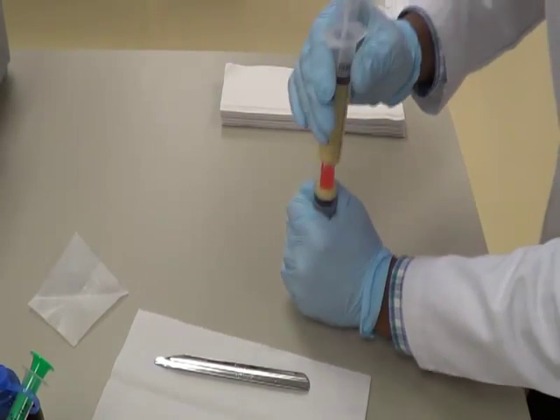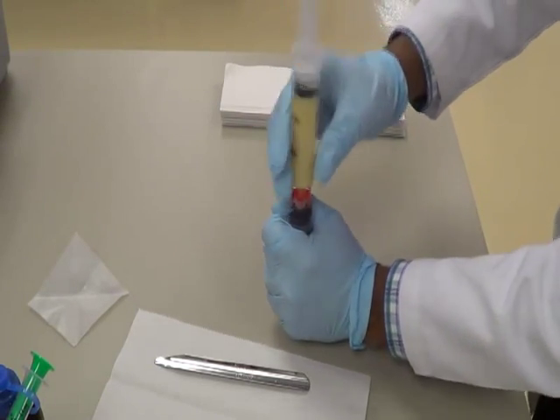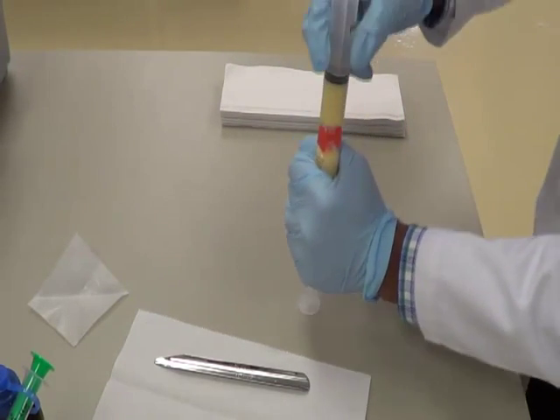Because of the shear stress that's caused by passing across the Luer locks, we will have a nice gel.